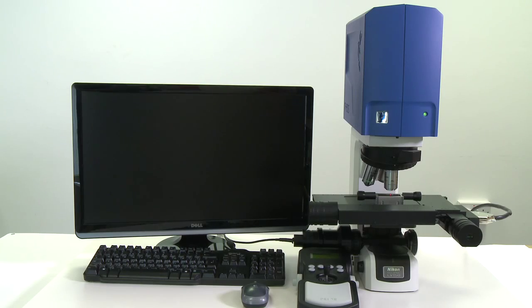With the n-gauge you can measure the film thickness, but you can also measure its refractive index directly, and that's useful because the refractive index is very often correlated with the material properties. If the sample is under strain, which is often the case if it's a polymer film or a metal oxide, then you can measure that strain directly via the birefringence of the material.